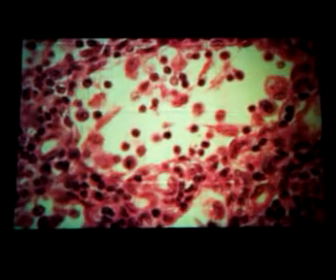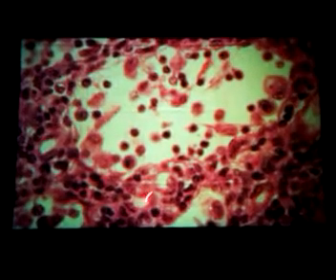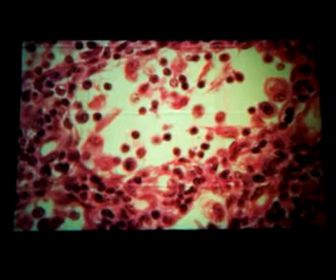Here you have your lymphocytes. Here you have most of your macrophages, even though it's a combination of both. It's just there's more lymphocytes here, more macrophages here. So the pink things that are on the inside here are actually the macrophages. The dark things up here are the lymphocytes. So you have each cell type in both locations. It's just their numbers change from inside to outside. The inside of the germinal center, again here, macrophages, lymphocytes, all of those things, and here you do have blood vessels that you could be asked to identify.